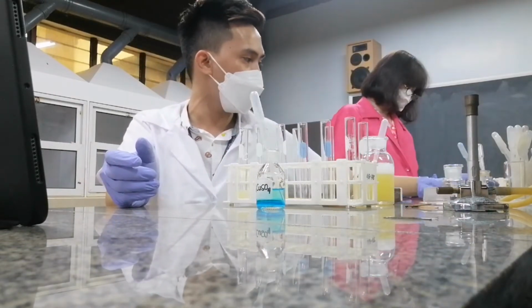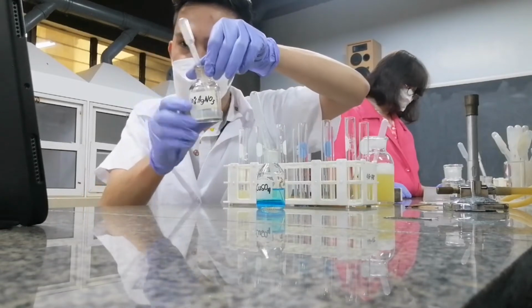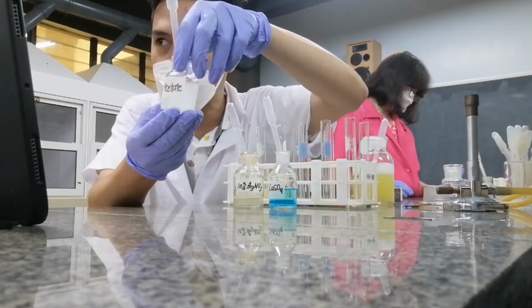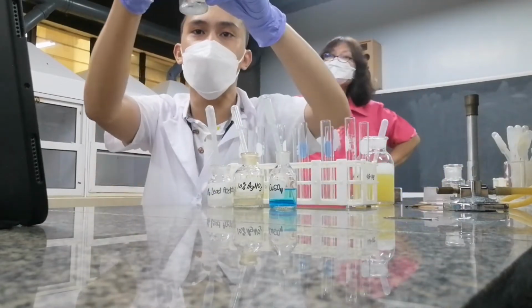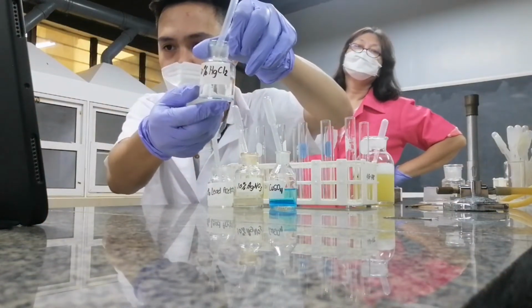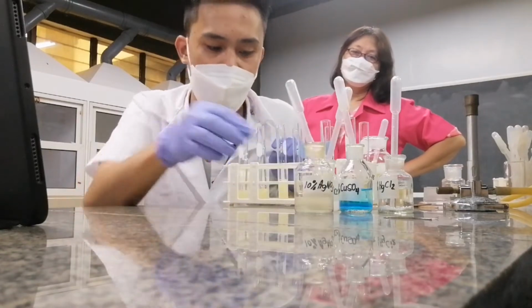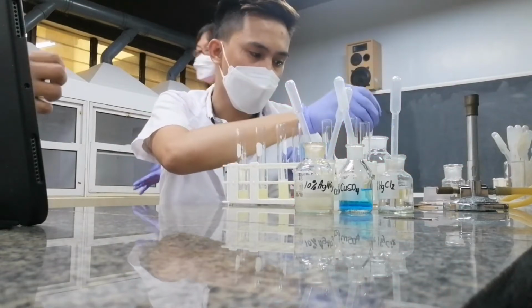And then I have here my silver in the form of silver nitrate. So these are metal salts. And I have here my lead, lead in the form of lead acetate. And then lastly, I have here my very, very toxic mercury. So careful with the mercury. Okay, very toxic. So what we're gonna do is add 1 ml of this heavy metal into test tubes containing albumin.